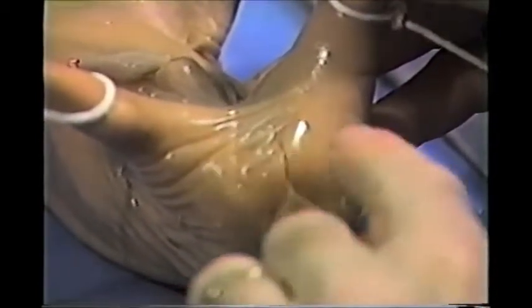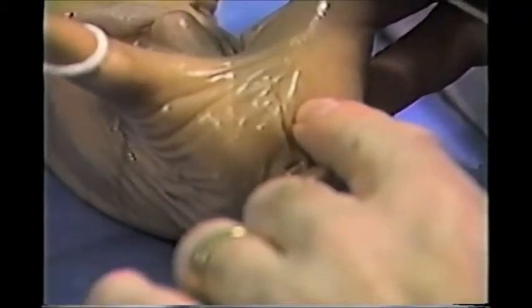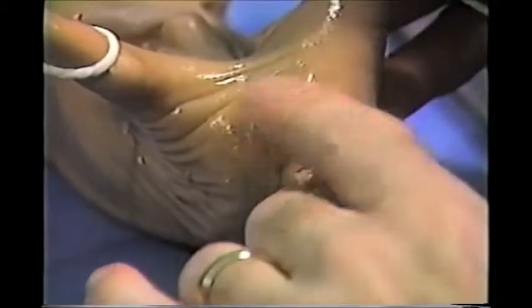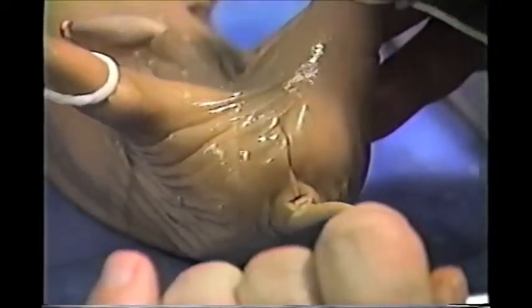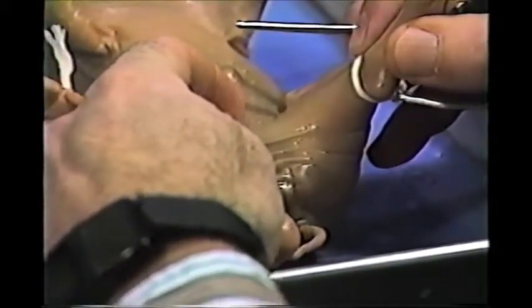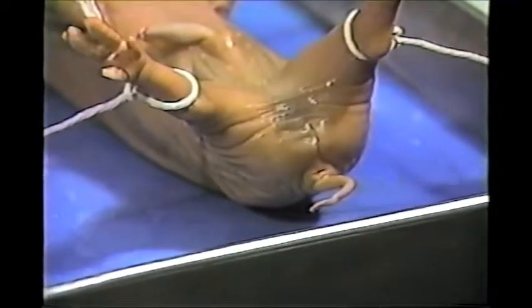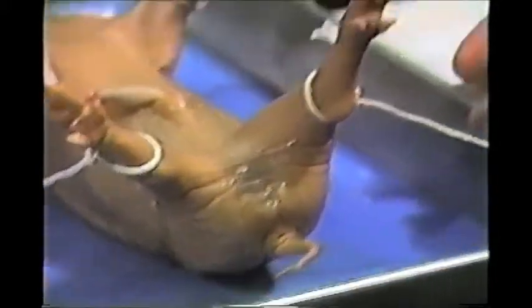He does have some swelling here, which is the scrotal sacs, but the testes haven't descended yet, so they don't look very prominent. When we dissect the male, we'll see how far the testes have gotten in their descent. They start out up here in the pelvic area and then descend down into the scrotum. Okay, so that's how to tell the difference between a male and female. I'm going to move the female out of the way and we'll dissect the male.